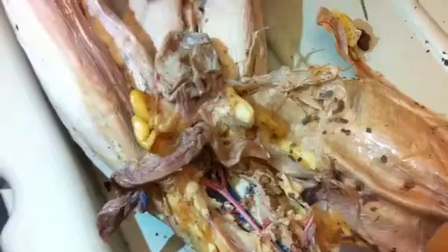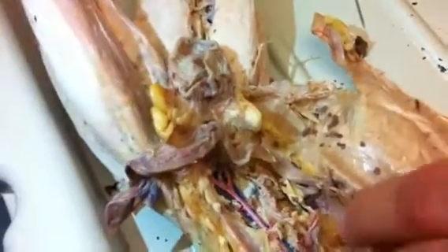Okay. That's one that goes. I probably won't point to that, but this is another adaptation that's different. Okay, and then the iliacs go. The external iliac goes to the femoral, and down there. Okay. And that's the cat.